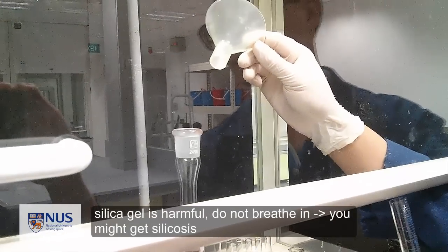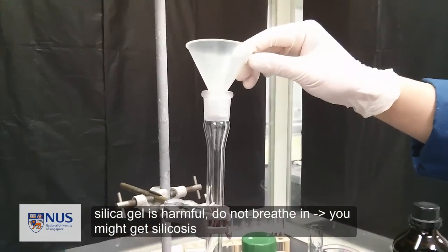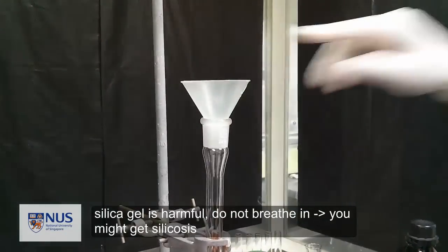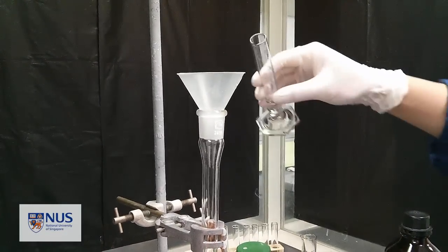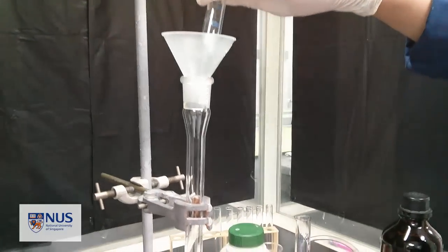This is to prevent the breathing in of toxic silica gel into our lungs. You may get silicosis, which is very harmful to our body. So take note, sash must be down. Here in the video, we're just doing a demonstration, so it's up.